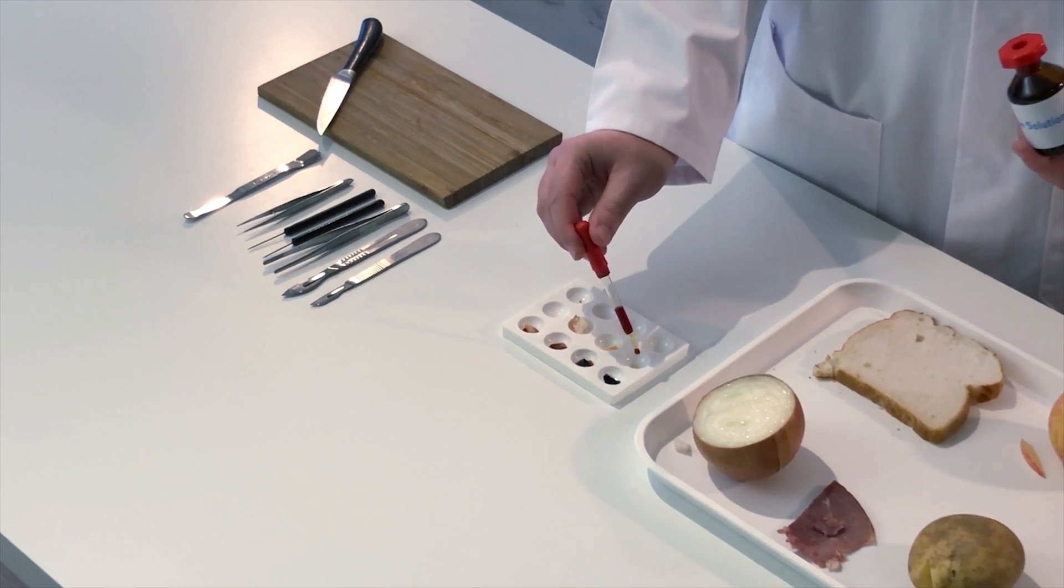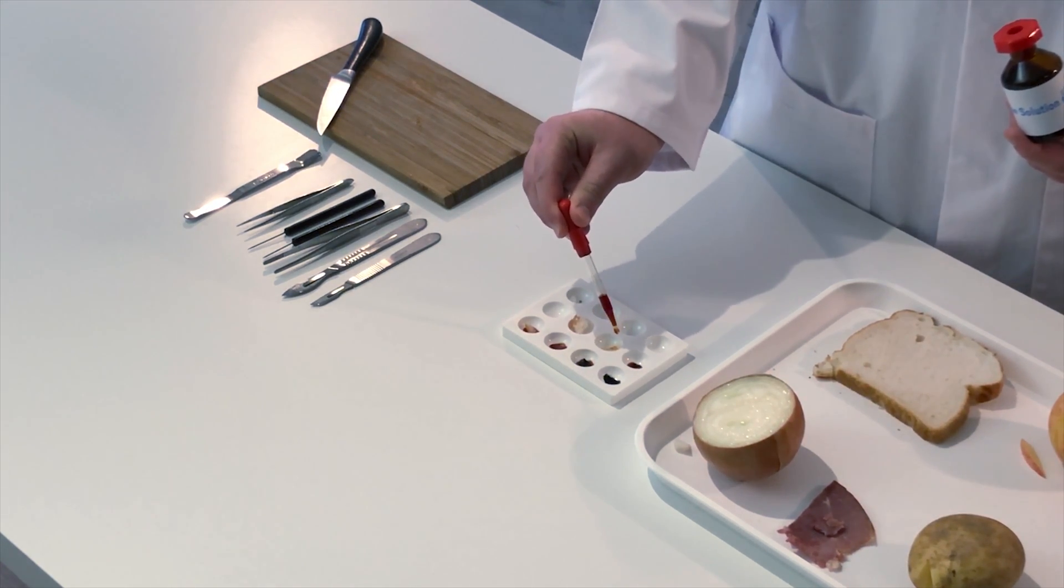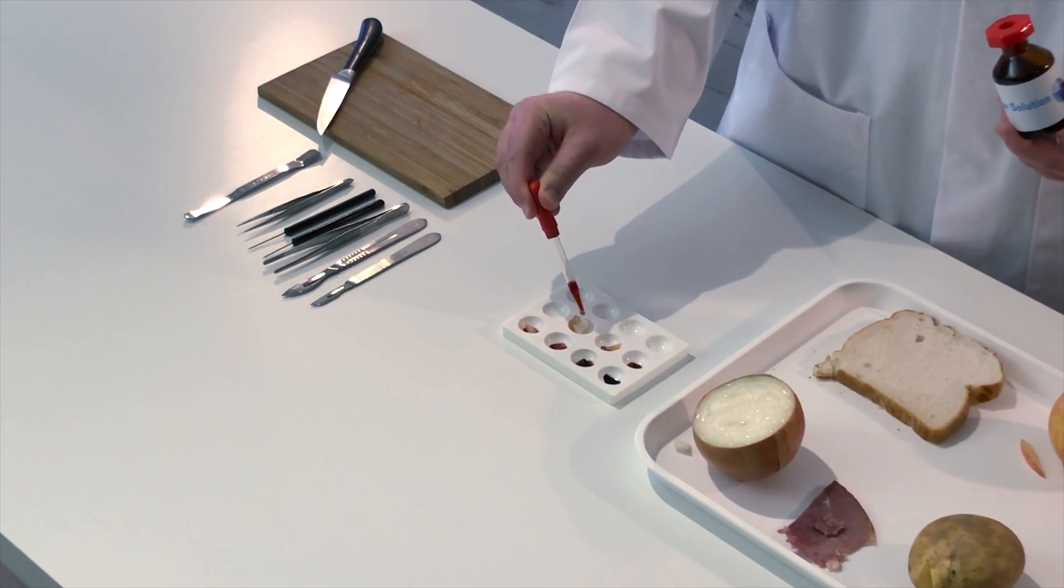And then we're just going to add iodine solution to the other three samples: pasta, apple, and bread.